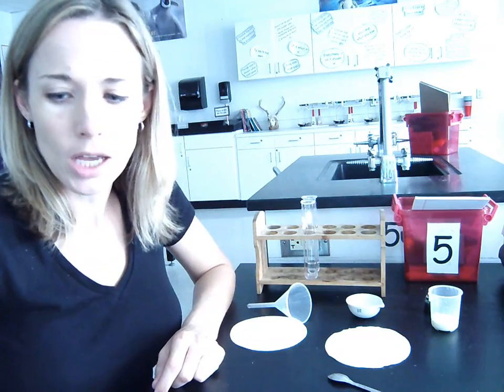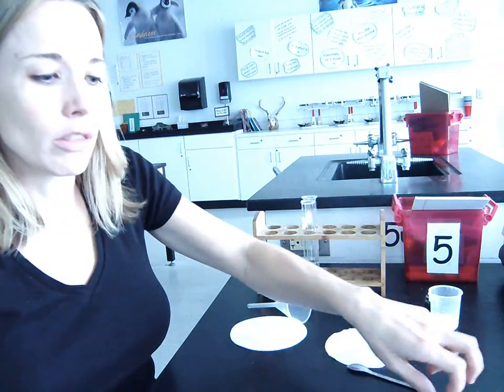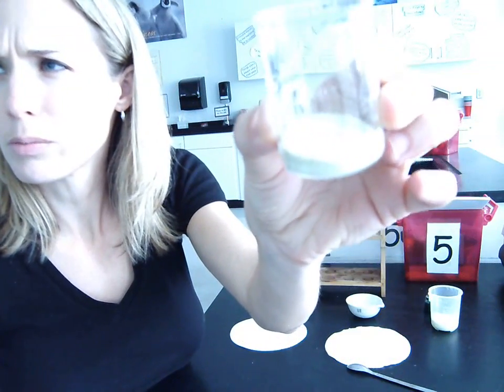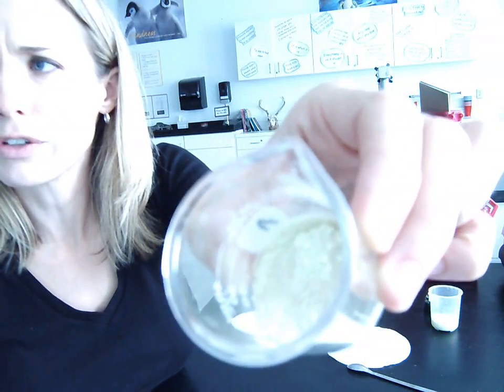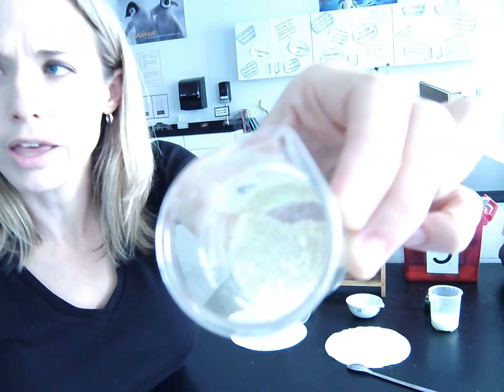So basically, here's an example, and you can read the section. It's pretty straightforward. The method is called separation by flotation, and using this method, it allows us to separate mixtures of insoluble solids. So here I have a mixture. I don't know if you can see it very well. There we go. There's a little bit of a glare. It's sand and sulfur mixed together.